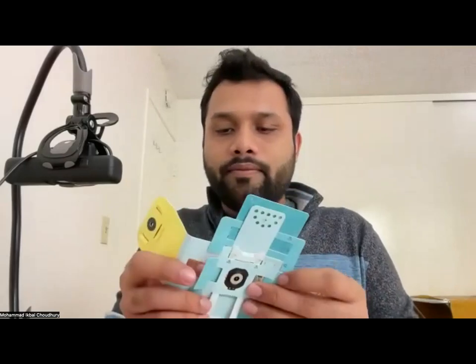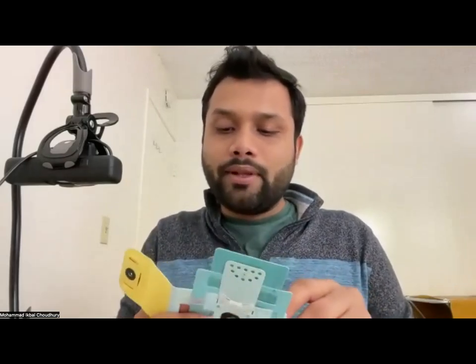Also just make sure, even with your eye, that the sample is mounted over the lens. I've checked that and still I'm not able to see it. You have to see it from the blue side. So the blue side should be close to your eye. You may not be able to see the sample for two reasons. One is the sample is not placed right on top of the lens.